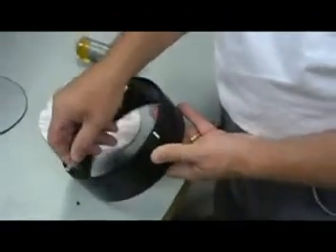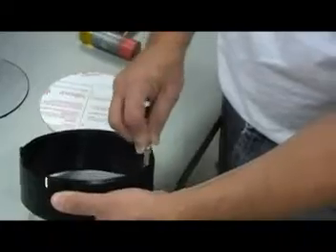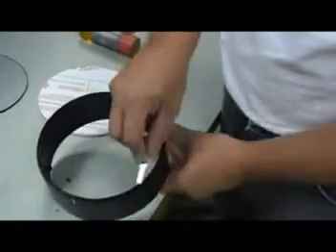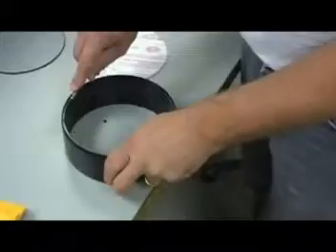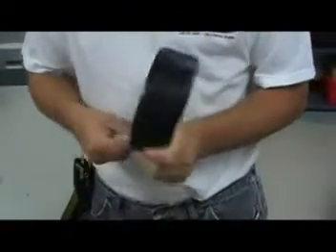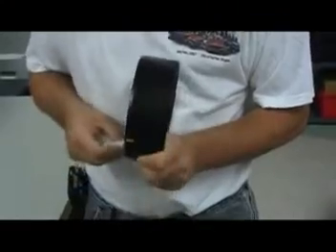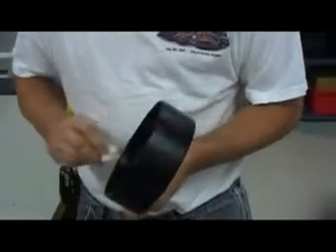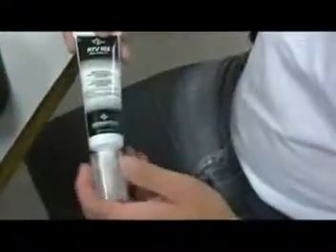Some areas might just take light pressure and you can peel it out in a long strip. In other places you might have to put a little bit of pressure on that blade in order to scrape out the old RTV. You can see I've got a little spot here that is taking a little bit extra work. Now we can take a paper towel and run it through the groove, through the entire circumference of that ring, making sure that it is completely clean before we proceed and start putting new RTV in place.